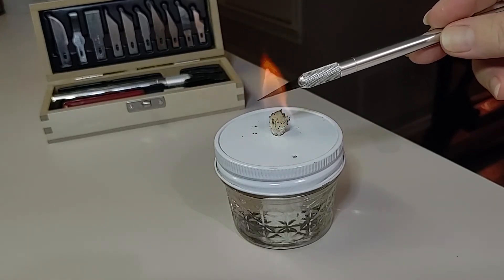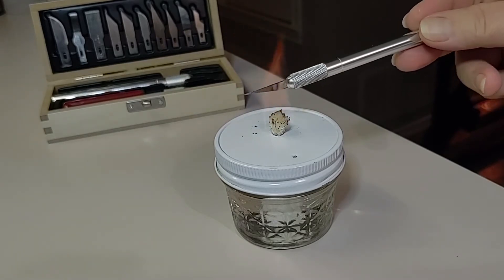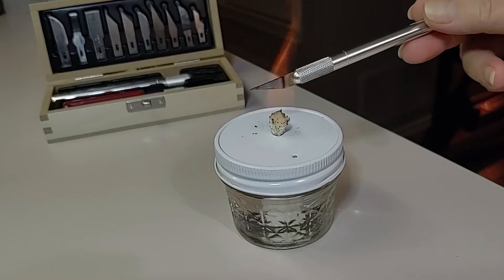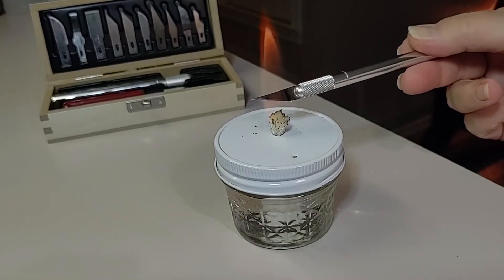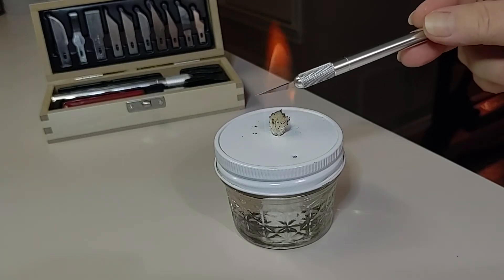Many times we will change it before we do agar transfers, so that our air is nice and purified and clean, filtering on a spore level. We will also be sharing this DIY alcohol lamp that we have created ourselves for pennies, for sanitization of our tools and utensils as we are transferring and cloning.